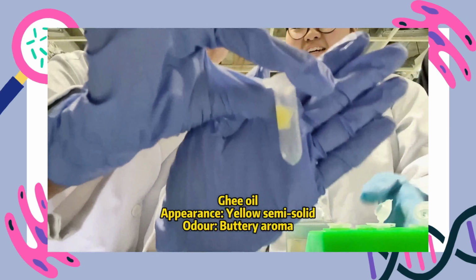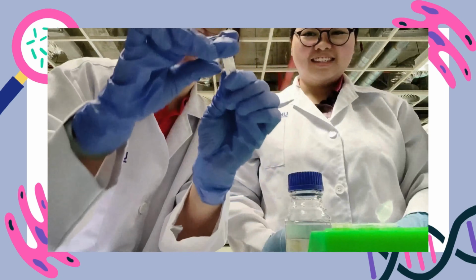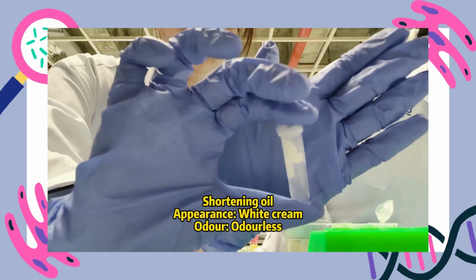Ghee oil is yellow semi-solid, has buttery aroma. Olive oil is yellow liquid, has greasy smell. Shortening oil is white cream and odorless.